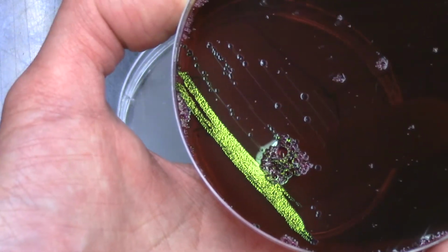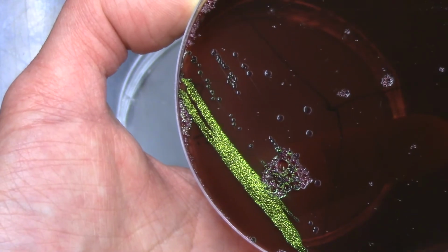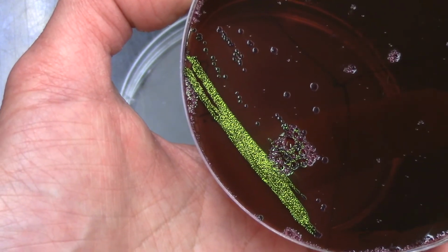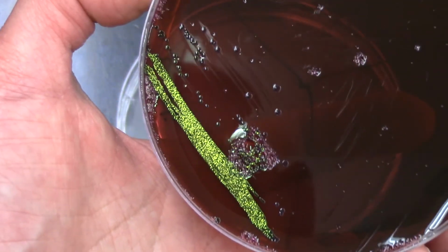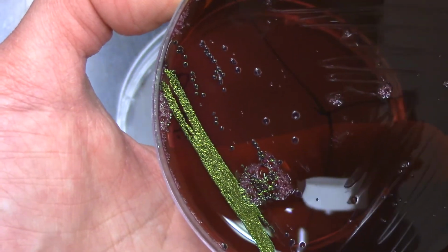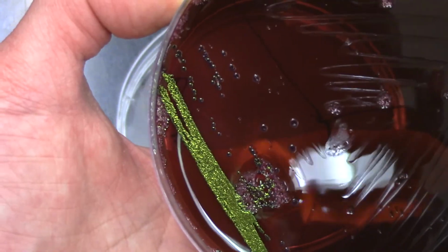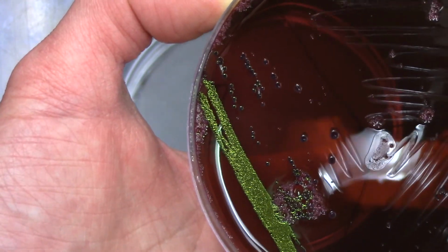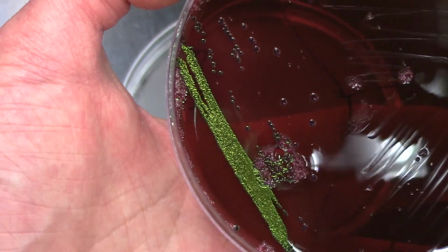But there I'm really zeroing in on that section that has the E. coli. And when that E. coli produces acidic products in this agar, you end up with this shiny iridescent gleam to it. And it's hard to see, but the actual colonies themselves are not creamy white like you would expect for E. coli when you can see individual colonies. They are black. So they have black centers, and when you're really getting a lot of those acidic products of fermentation, you end up with that iridescent sheen. So that's the differential part.